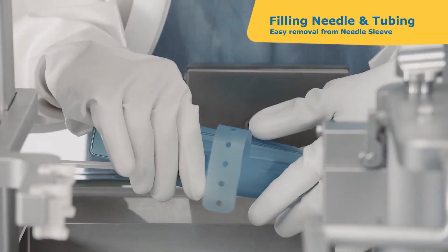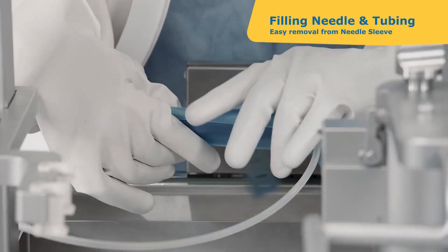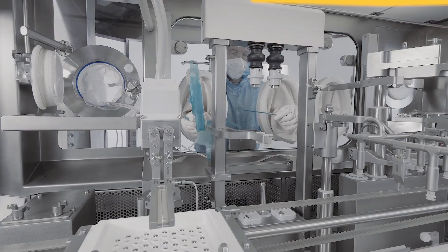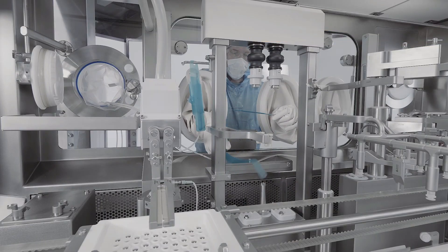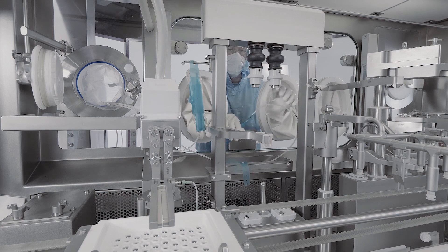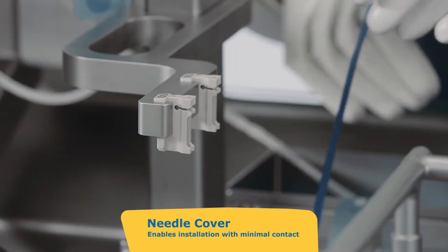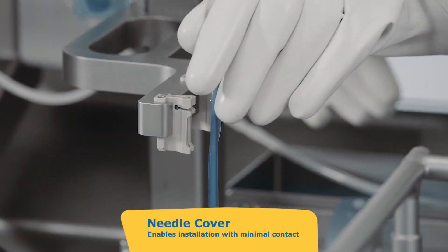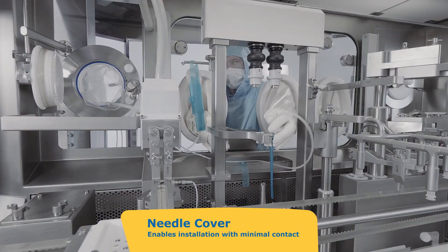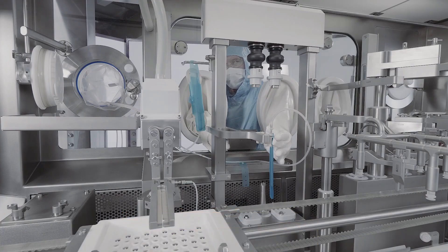Interventions: Interventions are highly restricted in isolators. Access is entirely through glove ports, and if a breach occurs, a full decontamination cycle is needed to restore sterility. Isolators rely more on technology than human intervention, reducing the risk of contamination.